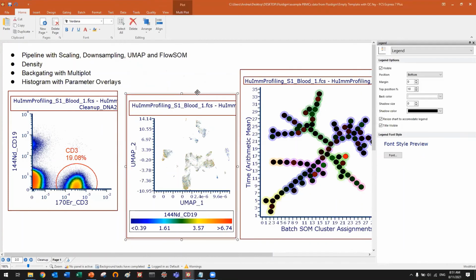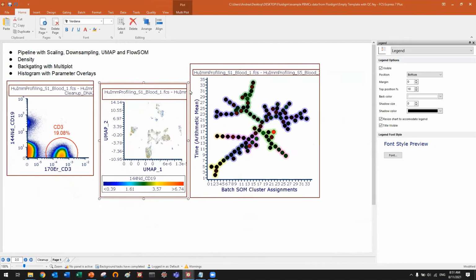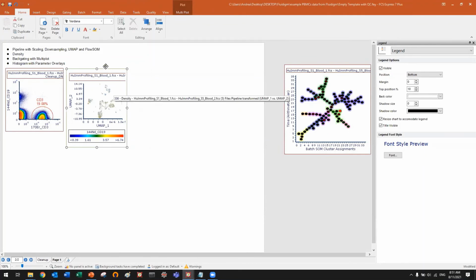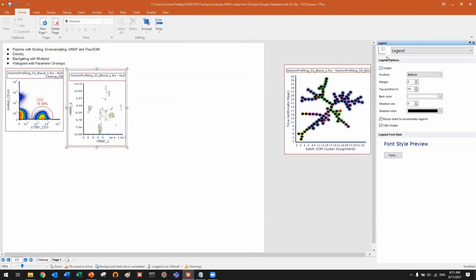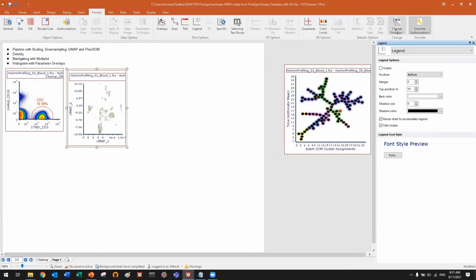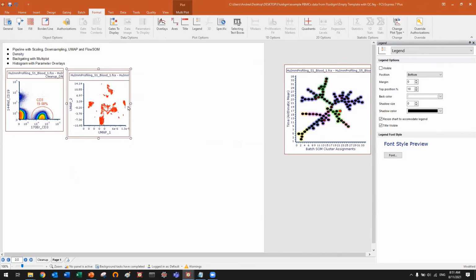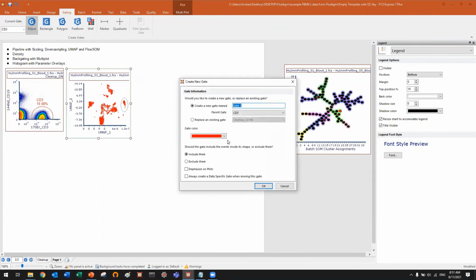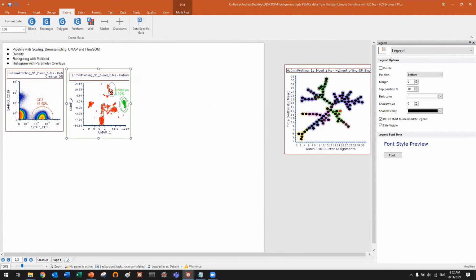Another way, and then I will conclude, is to use backgating. I didn't show you backgating before. Let me increase a little bit. So if this is a color plot, since the CD3 gate is red, all the events on this plot are red. But you see, if I create a gate, let's say on these islands, and I make this gate blue or green, let's say unknown population, now I can see that these populations are green.